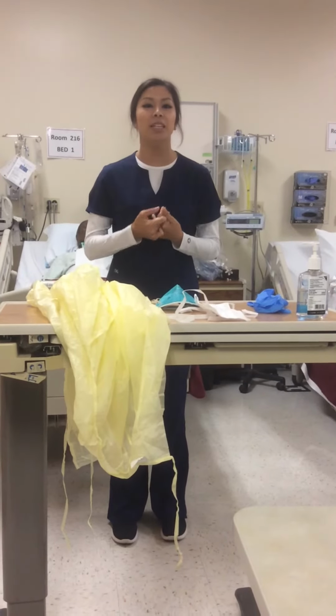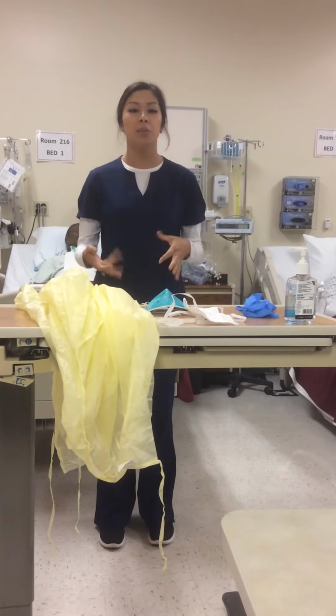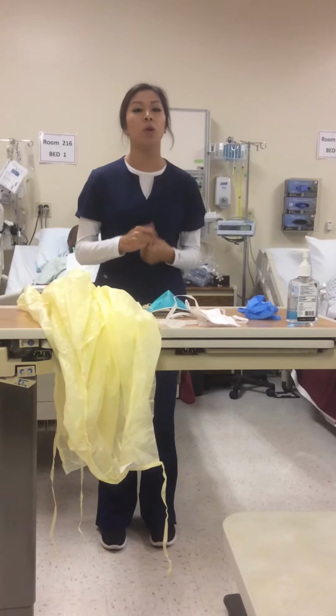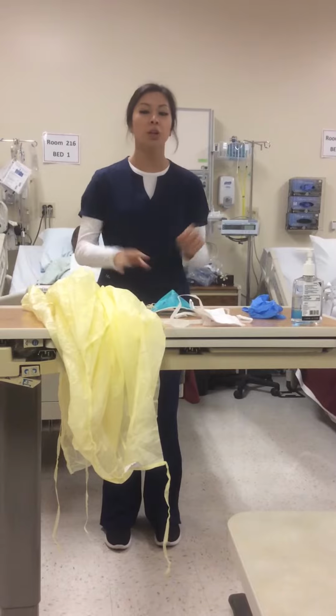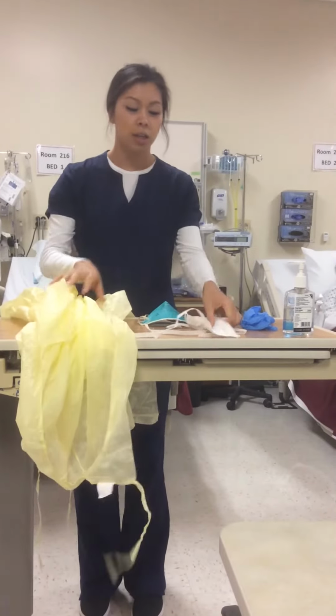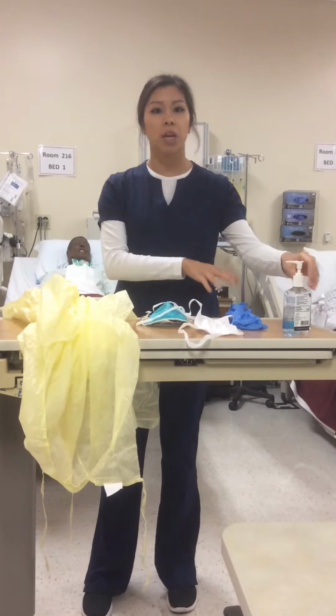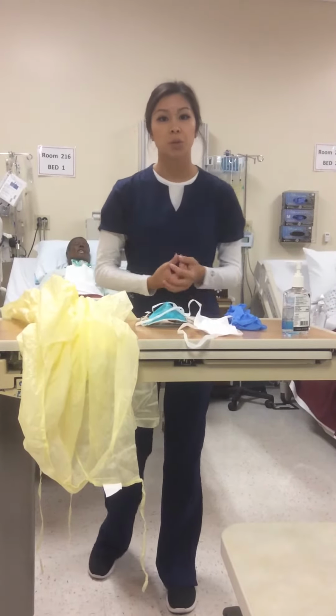My name is Diana Ivy Cedeno, and today I'll be talking about how to properly put on your personal protective equipment, or PPE for short. For standard precautions, you would just need a gown, a surgical mask, gloves, and of course you would want to wash your hands before and after exiting the patient's room.